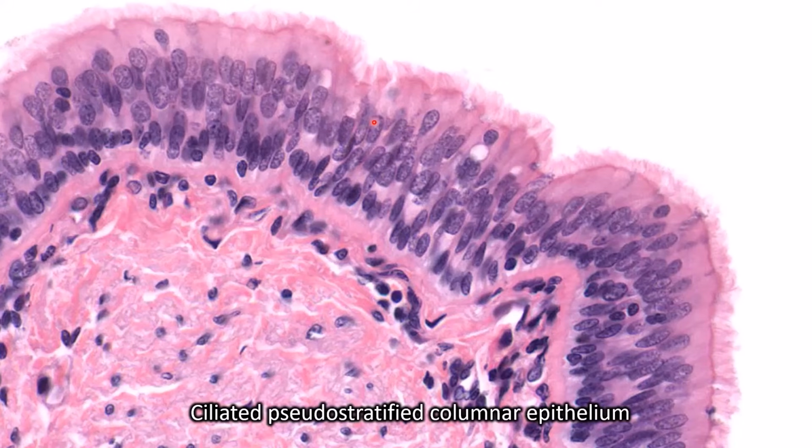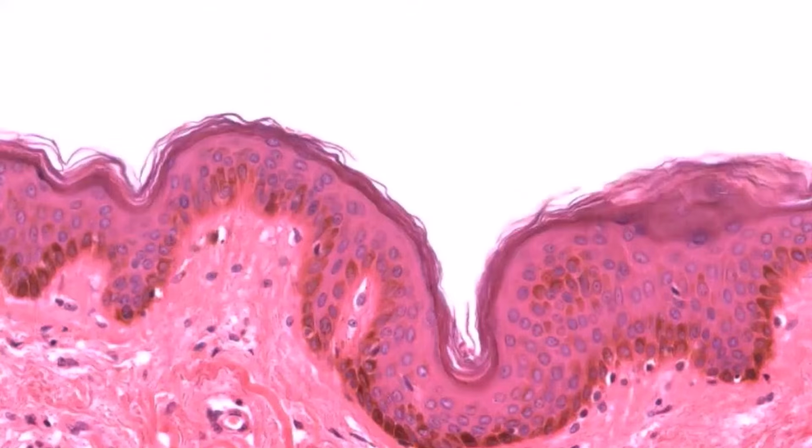So you see multiple rows of nuclei with cilia, which you would not see in stratified columnar. It should be obvious to you that this is ciliated pseudostratified.